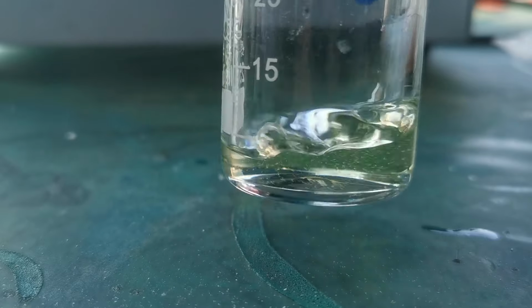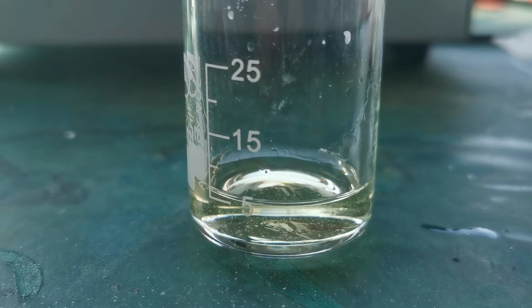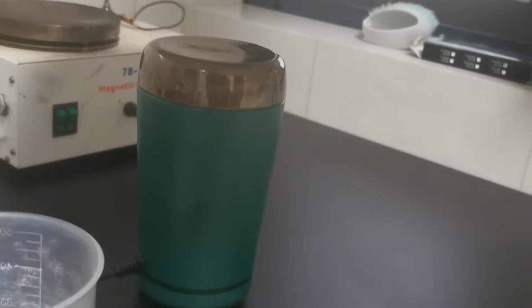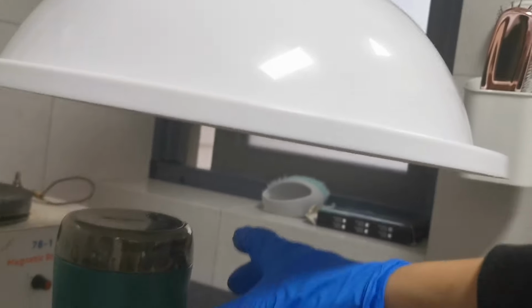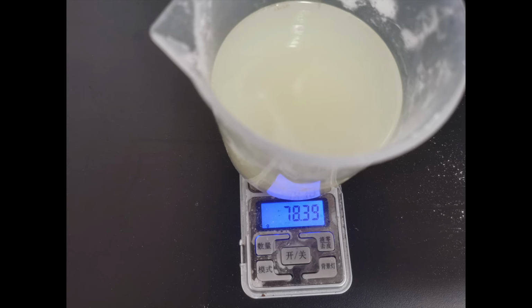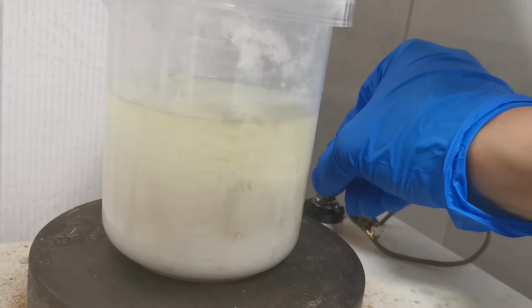Looking back, it may also be one of the possible reasons that the entire thing failed, but oh well. I measured out 80 grams of TCCA pellets and ground them up in a blender. This step releases a lot of very noxious dusts, so be sure to do this in a well-ventilated area and wear a respirator. I then added 280 grams of the DCE, and immediately started dissolving the TCCA to give a yellow color. The mixture is stirred for 10 minutes to fully dissolve the TCCA into the DCE.